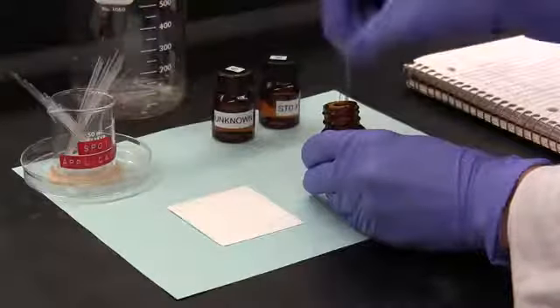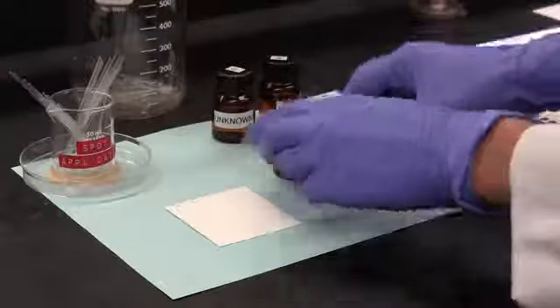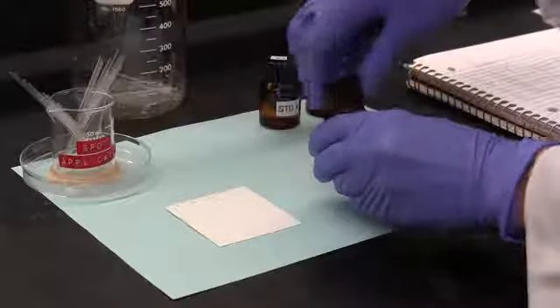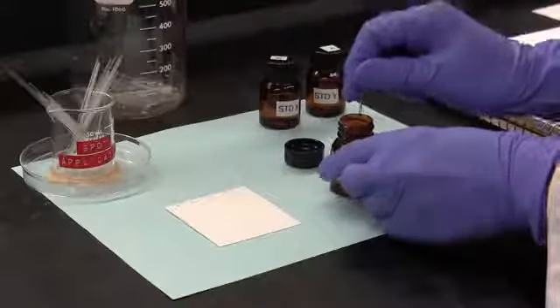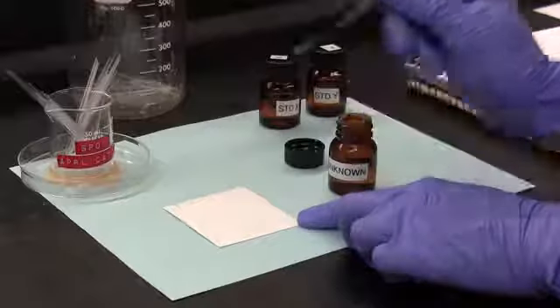Now in lane B at the origin, we apply a spot of standard Y, and once more at the origin in lane C. And note how we use a clean capillary applicator with each solution. This is to avoid cross-contamination between the lanes. And so with a clean capillary applicator, we apply a spot of the unknown in lane D.